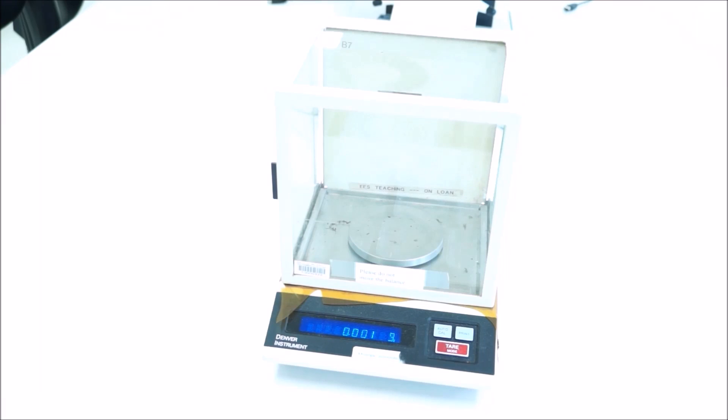Another thing to remember is to keep your experiment nice and consistent—always use the same scales. There are one or two scales per bench, but to keep your experiment consistent, I'd use the same set of scales every time.